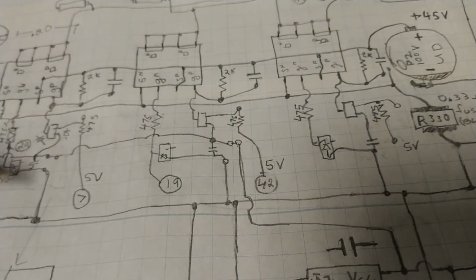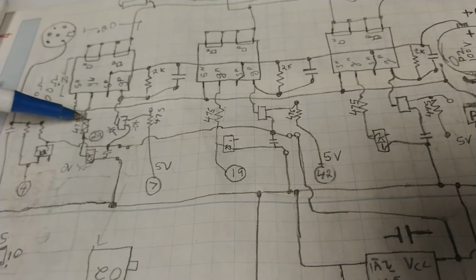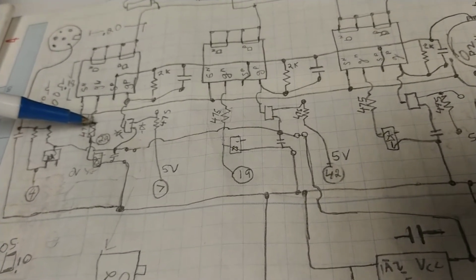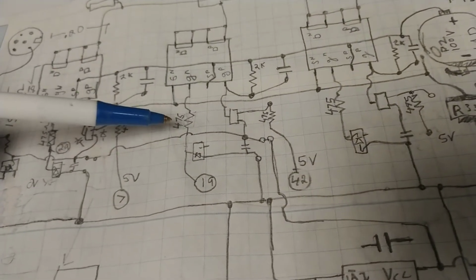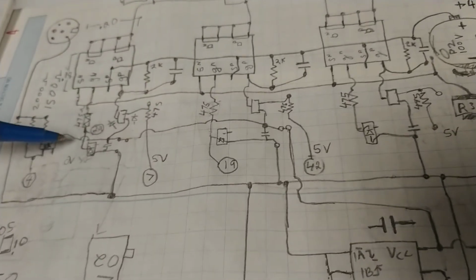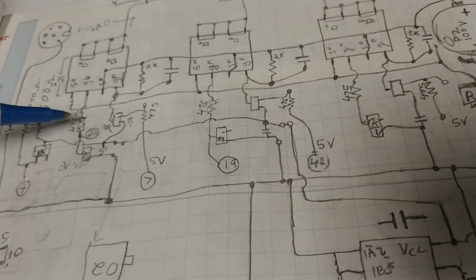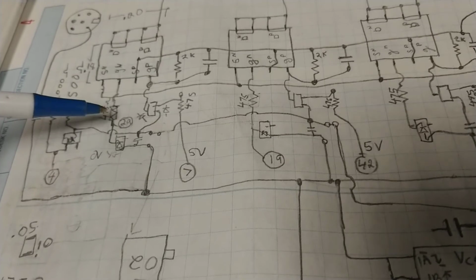This resistor had burned, it got hot enough to burn the numbers. You couldn't read the numbers. However, because we had some nice identical circuits, I could get the number of the resistance. The 475 burnt resistor had increased its ohms, which is good. It increased instead of decreased, to 2,000 ohms or so.